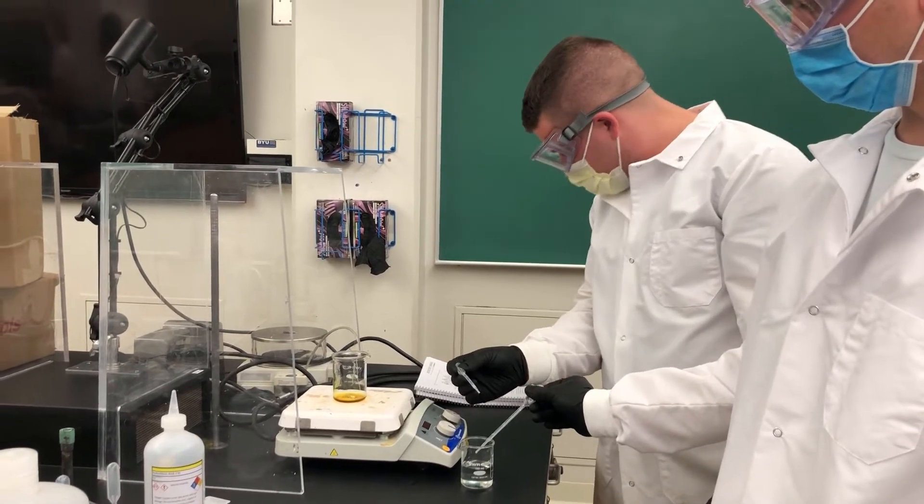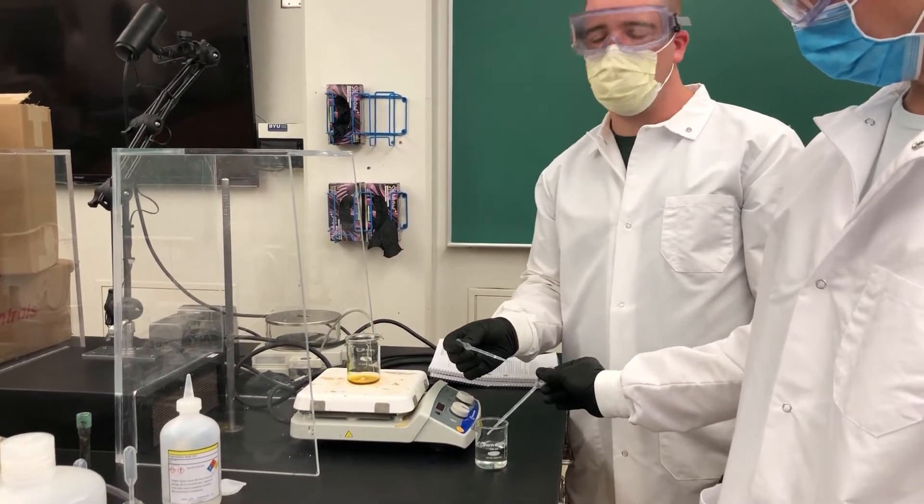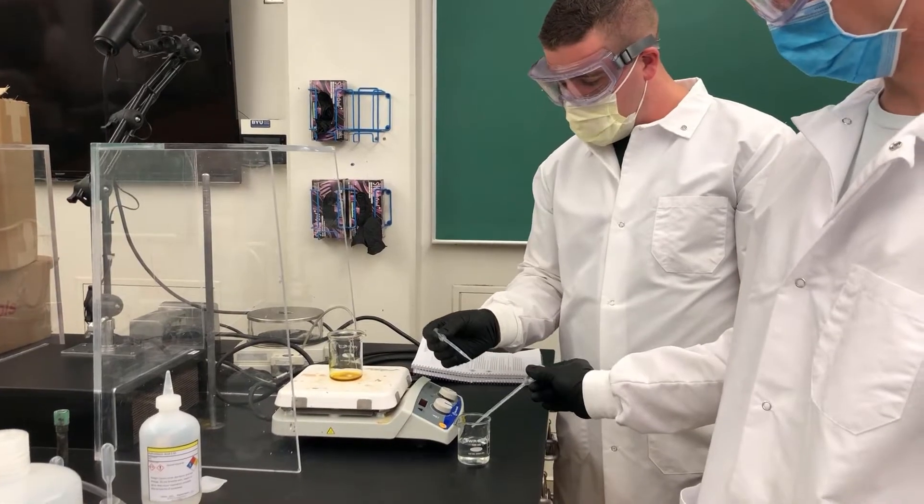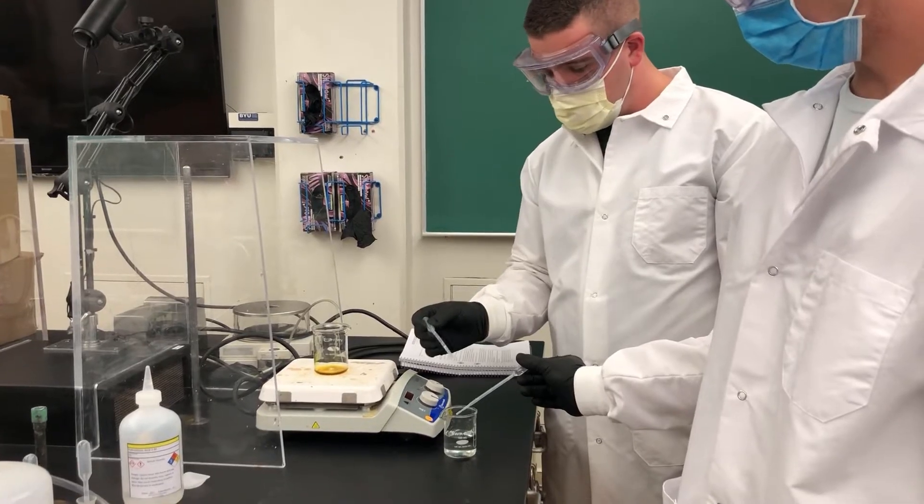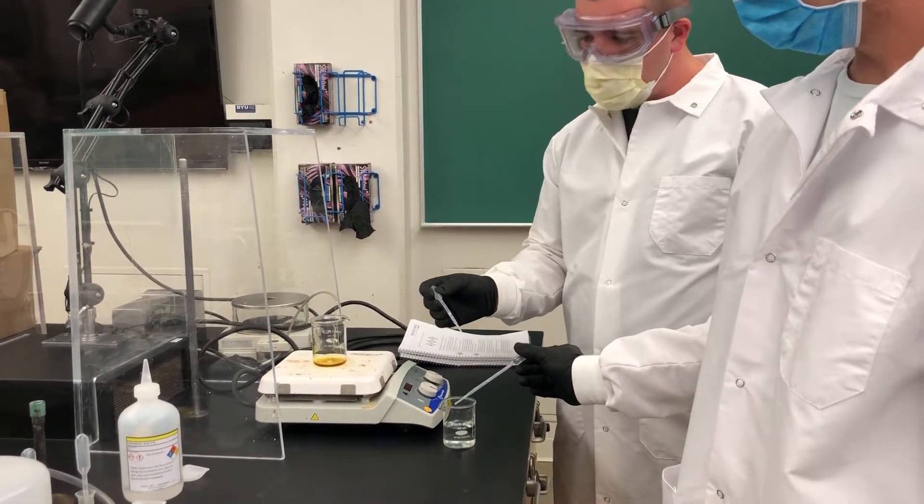So now we are on step 5 of creating our ferrofluid. And we are about to add ammonia to our iron chloride solution. And this has to be done within 5 minutes.